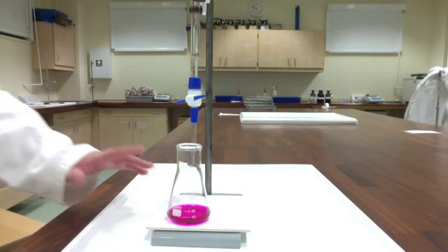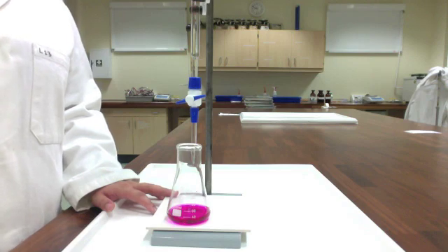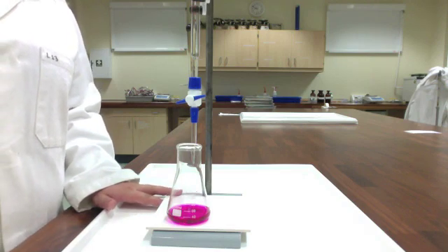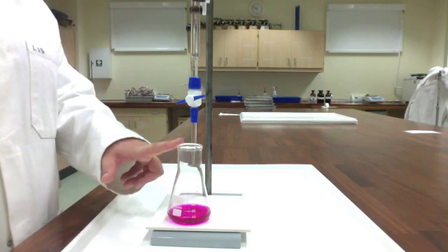I can see that this one added just under 11 milliliters. So it was just about 11 milliliters, and that was slightly too much.